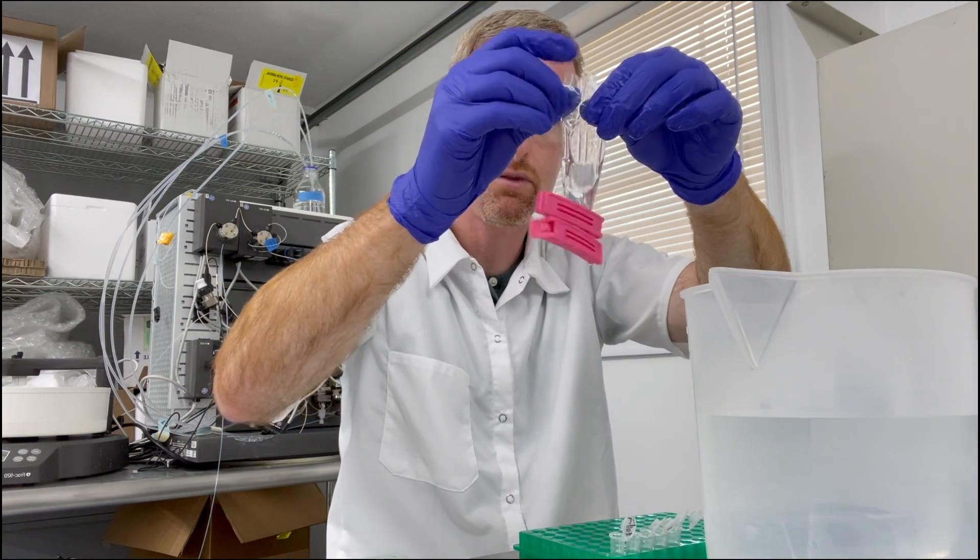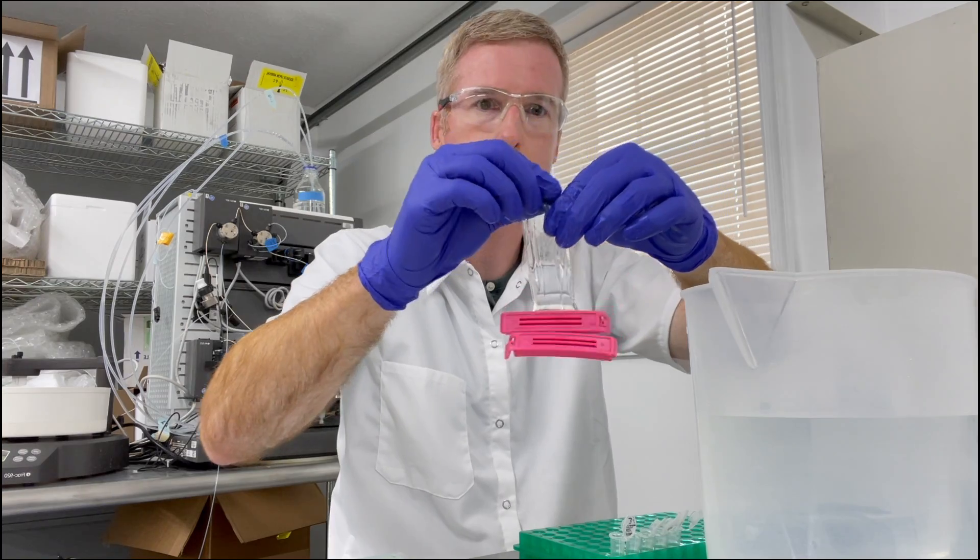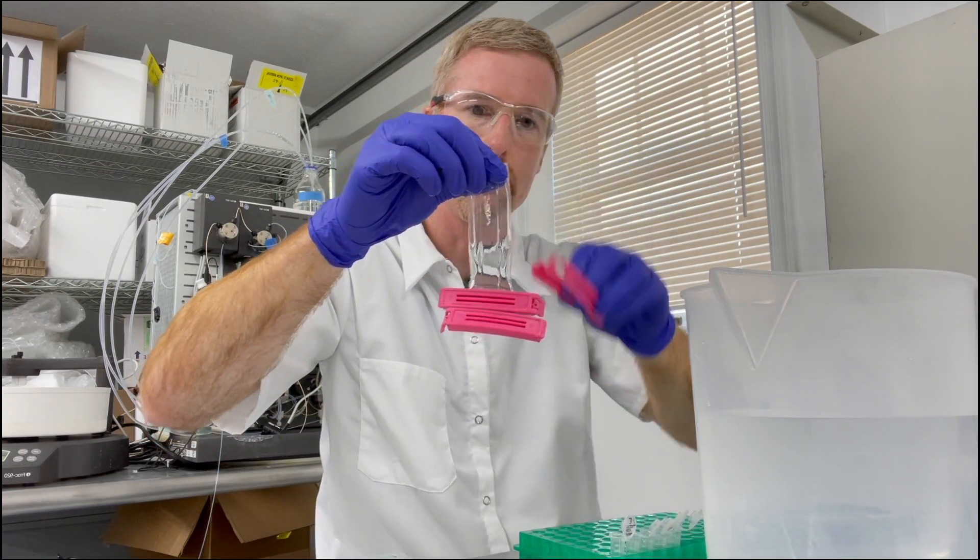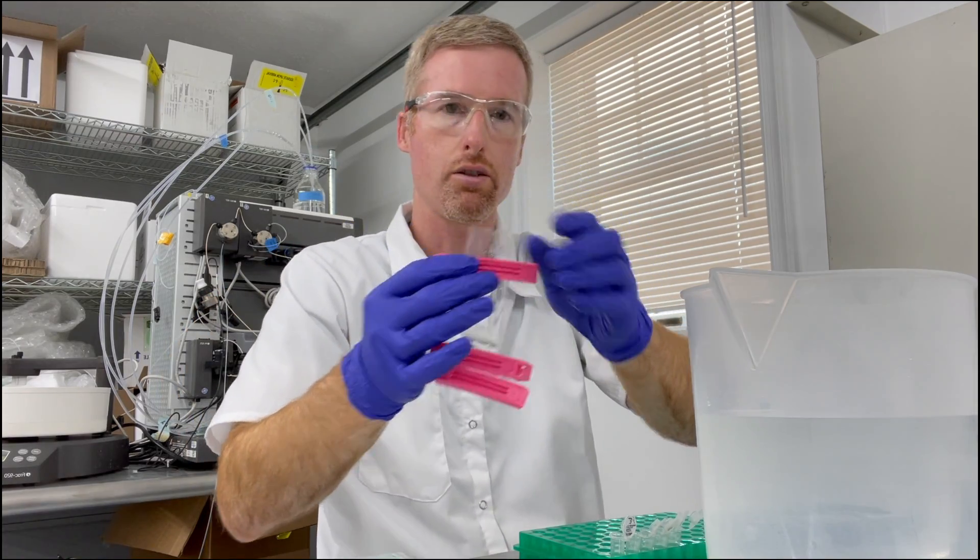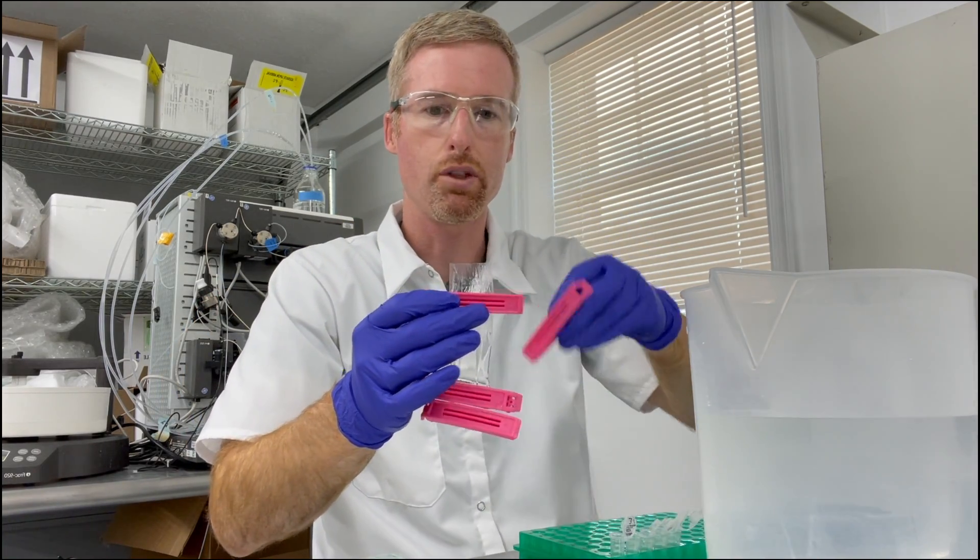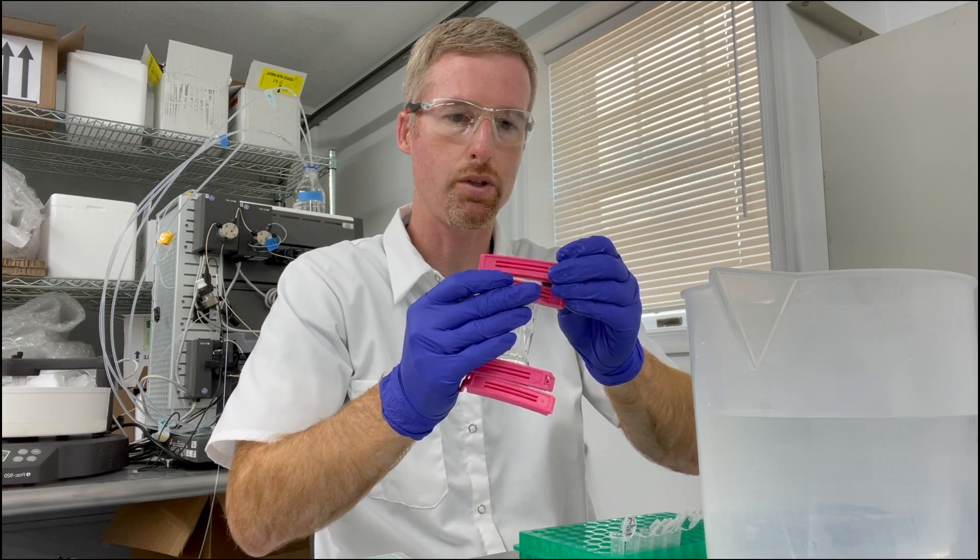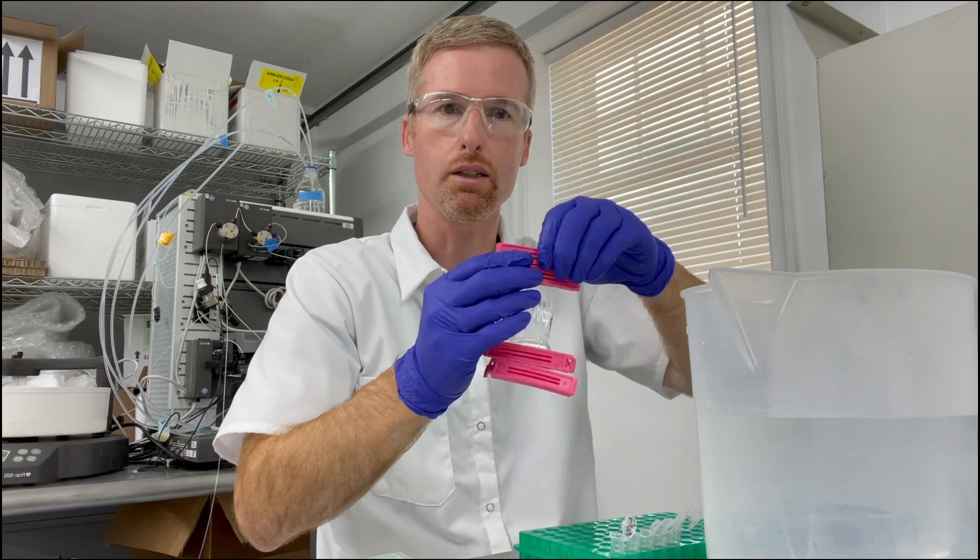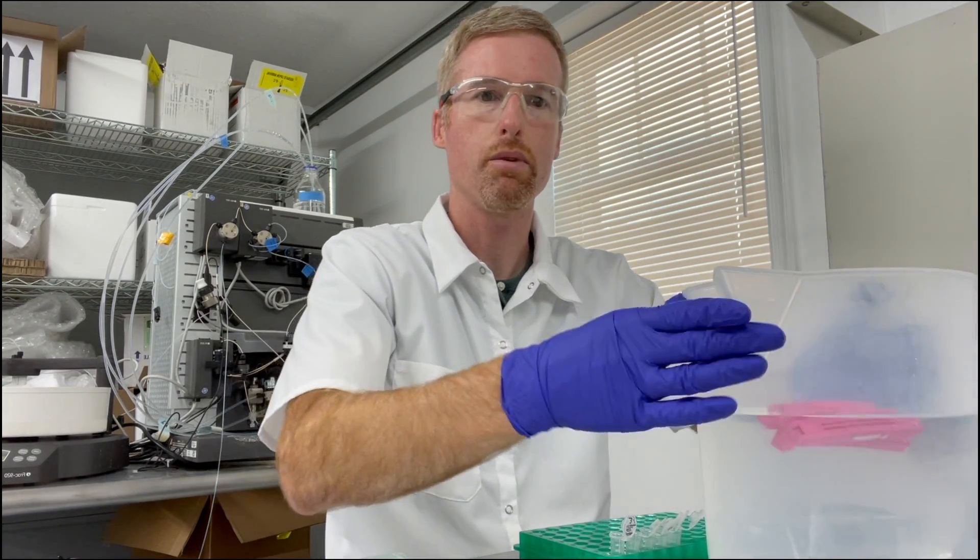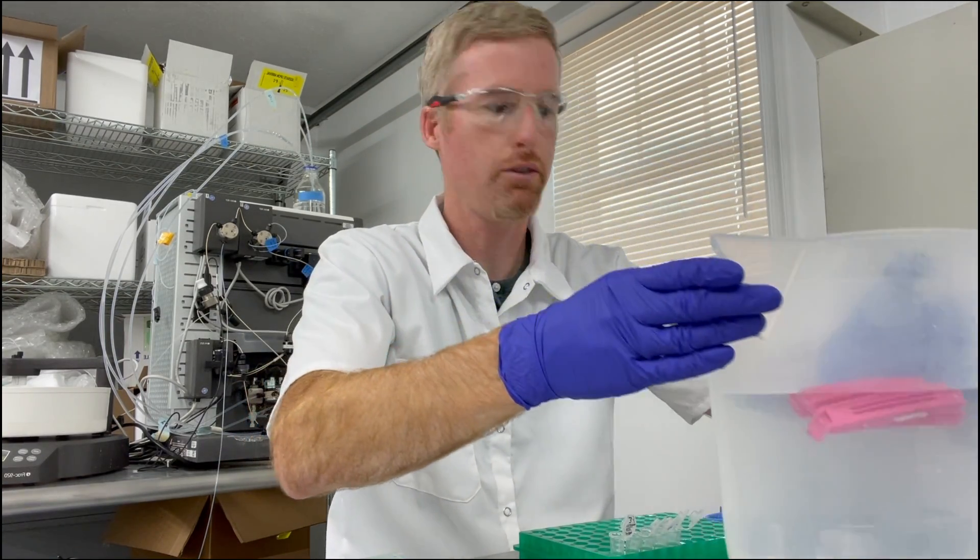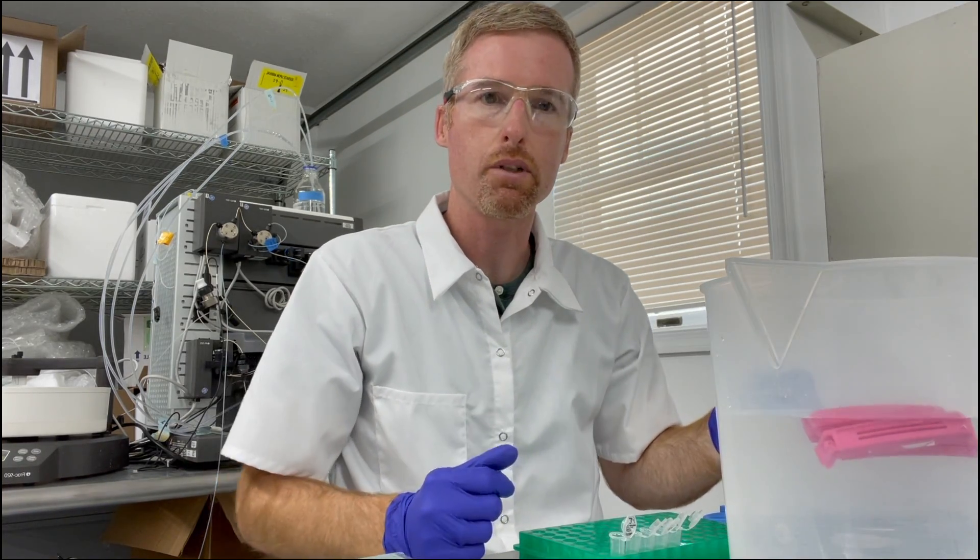I'm going to smooth out the top again so there's no wrinkles and then clip the top, making sure to leave a little space between the protein and my clip so I don't squeeze protein into the clip. Okay, so I'm going to put the protein in the beaker full of buffer, drop the stir bar, and then I'm going to take it over to the fridge.